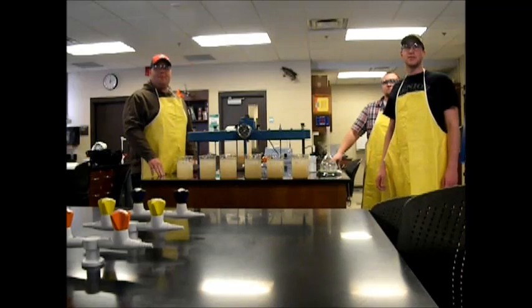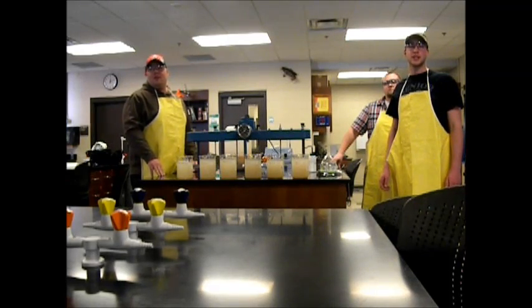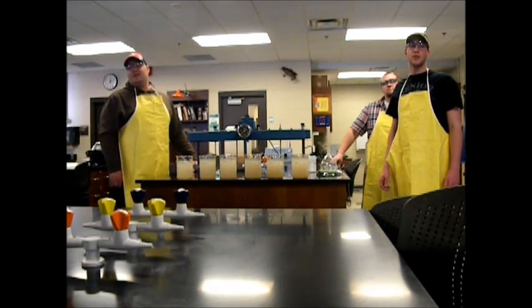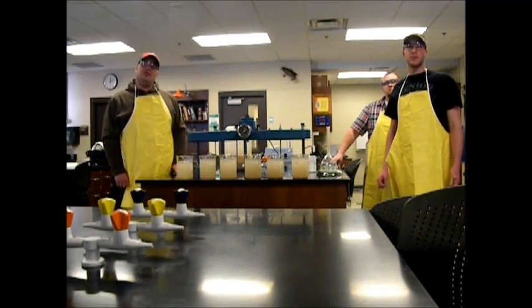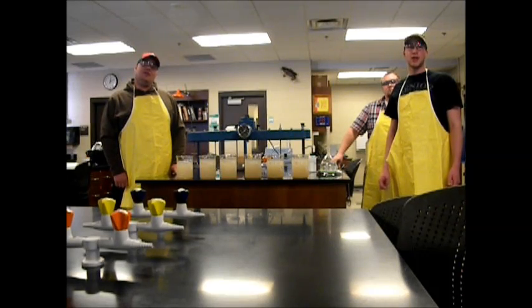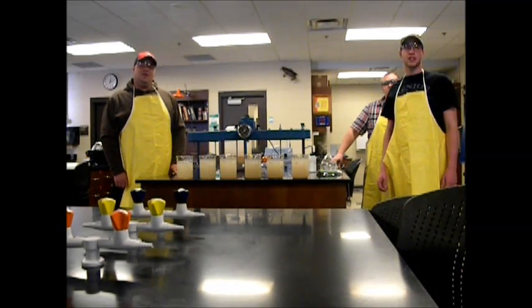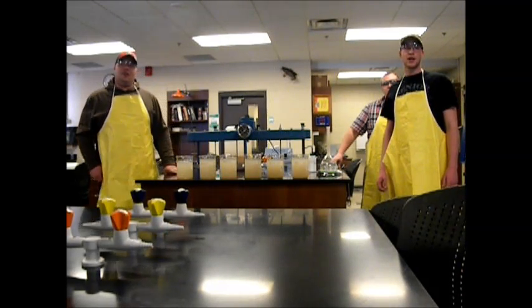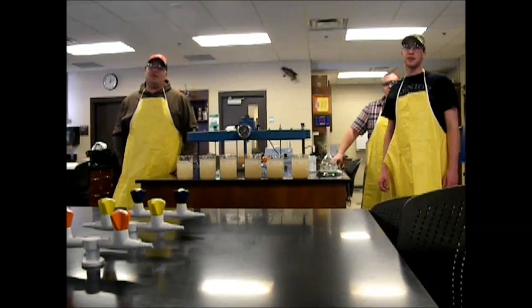What the jar test is — it's a method of simulating a full-scale wastewater treatment process. Common applications are turbidity, phosphorus, color, softening, and heavy metals.